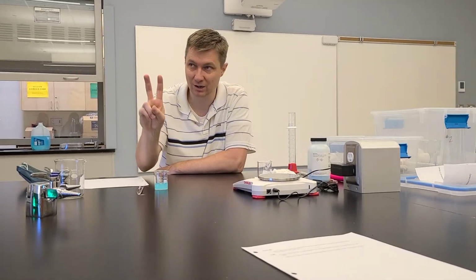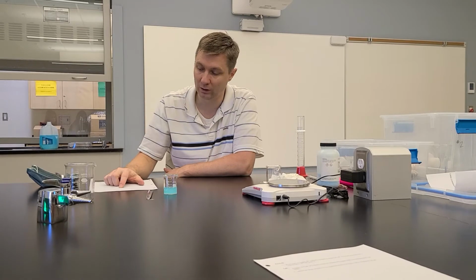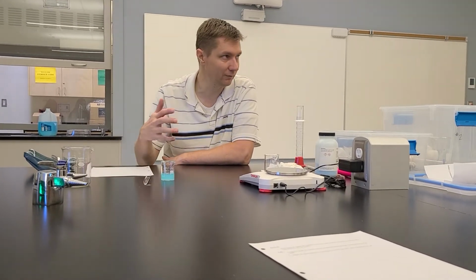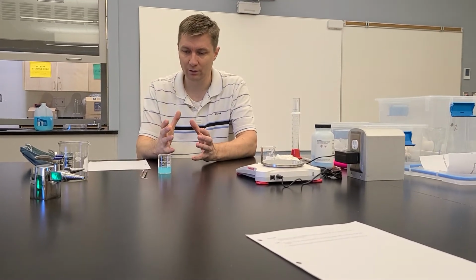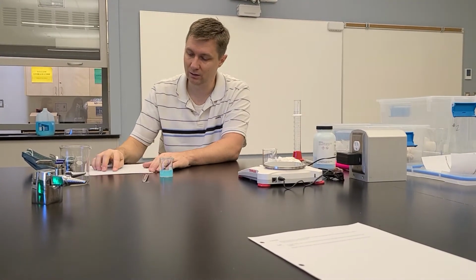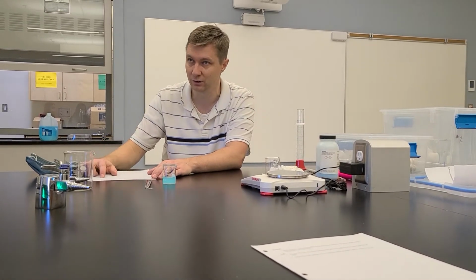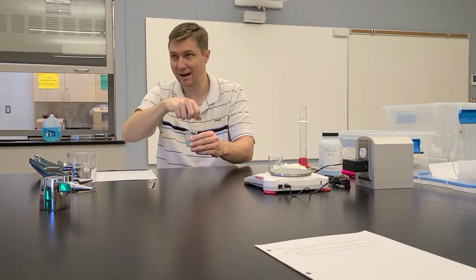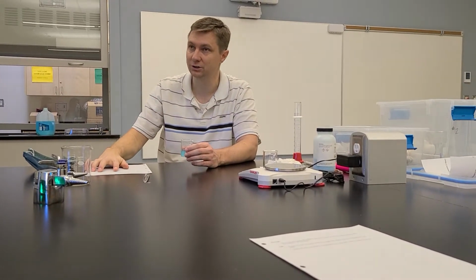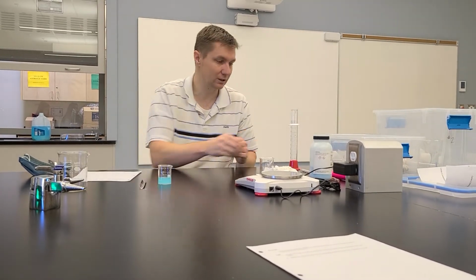So that part's done. Now step 2 here is the actual dilution. It wants you to dilute the stock solution to a concentration of 0.1 moles per liter with a volume of 150 milliliters. So when you do this, you want to make sure that you're using that C1V1 equals C2V2 formula, okay? Because this is your C2, the 0.1 moles per liter, and the 150 milliliters is your V2, you need to know how much of this you are going to pipette out in order to get that concentration with that volume. Does that make sense? So you do your calculation with that, and again, you can check that with me before you carry on.